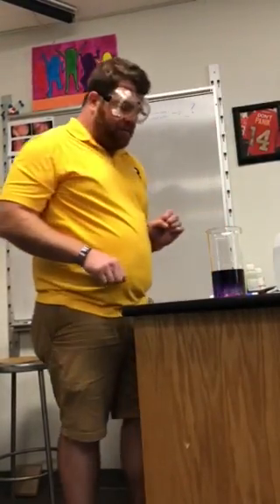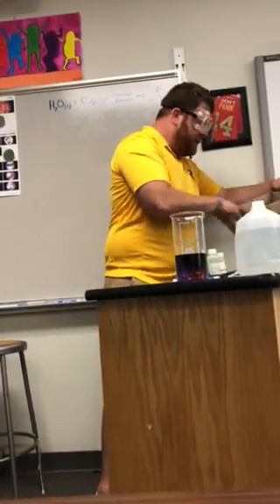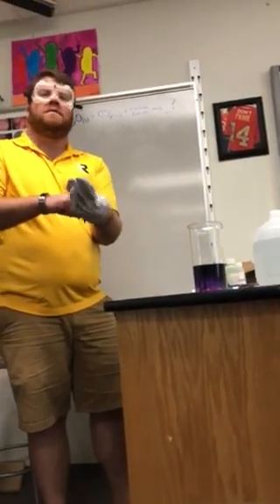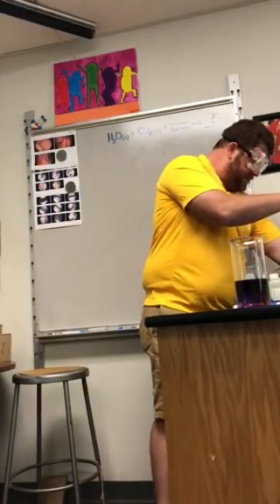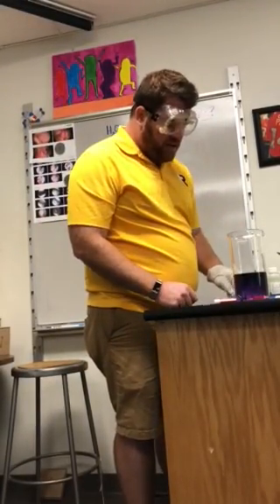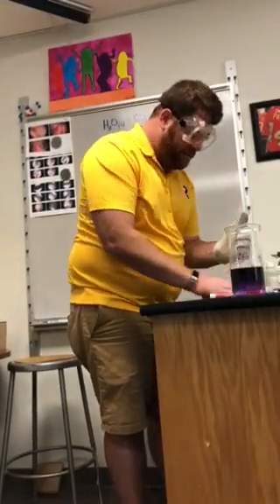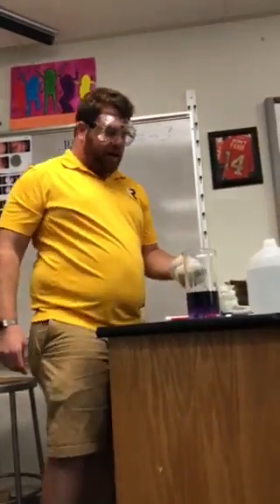All right, next thing. I'm going to take some dry ice out, okay? And I went ahead and bought this morning. Dry ice is an amazing substance. It's very cheap. You can do a lot of fun things with it, especially around Halloween. But I'm going to drop a little bit in here. I'm going to have to pick up some more for tomorrow because dry ice does not stay around a lot, just because it breaks down. So I'm going to use my other glove. You know what? We're just going to stick the whole thing in there. Why not? Okay? Let's do it.